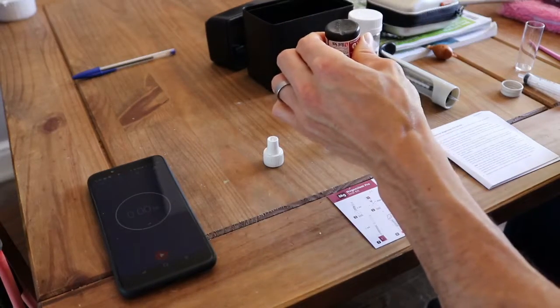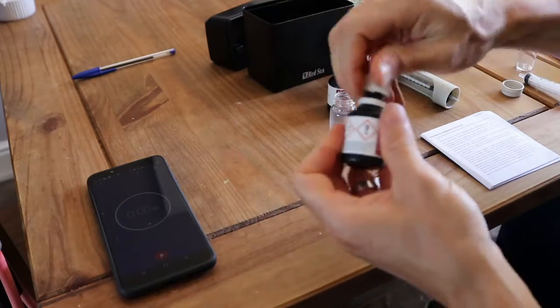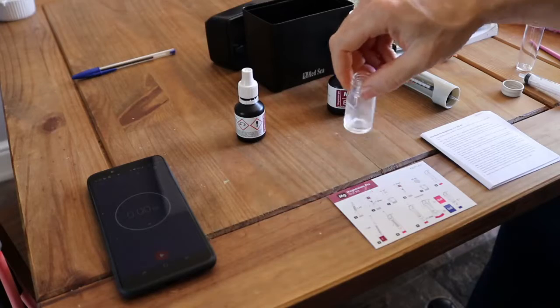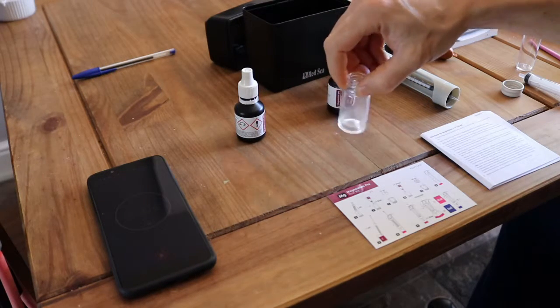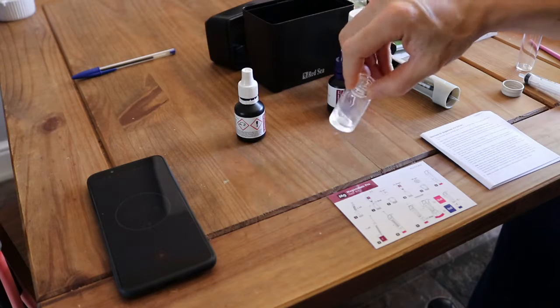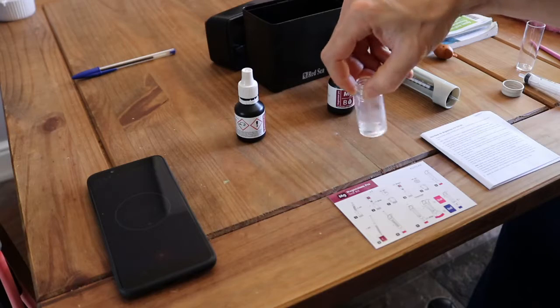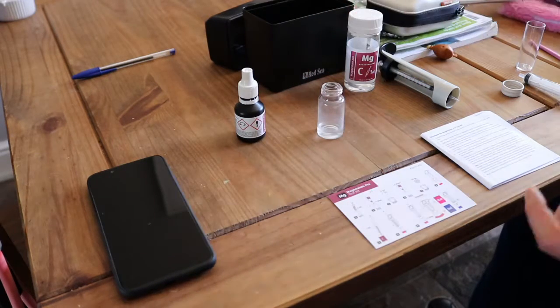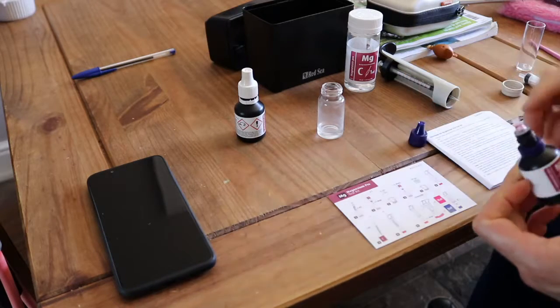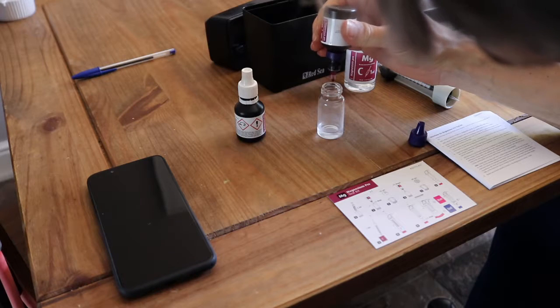Now you can see that you start getting some residue building up on the vial, and something's precipitating out there. I'm not actually sure at a chemical level what's going on. It probably is quite easy to find out, but I'm not really that interested. They do say the magnesium test does require cleaning after every test, because that can affect future results. So now, onto your 5 drops of B.